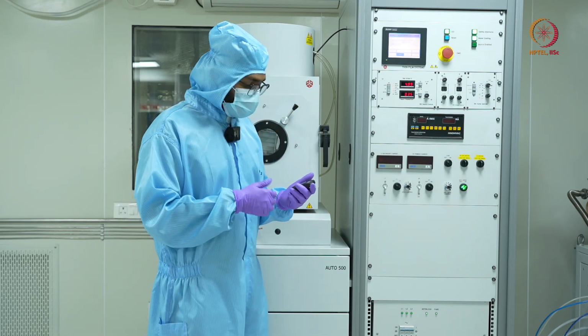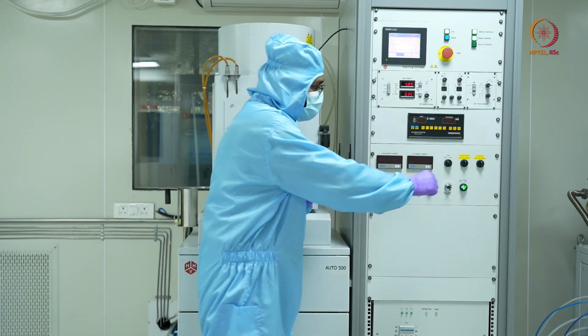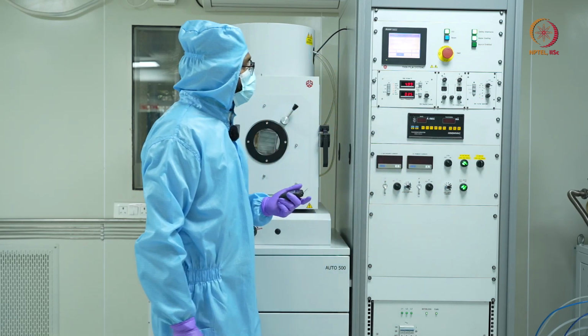So we will be depositing for 10 minutes. So I'll just turn on the shutter and start the stopwatch.